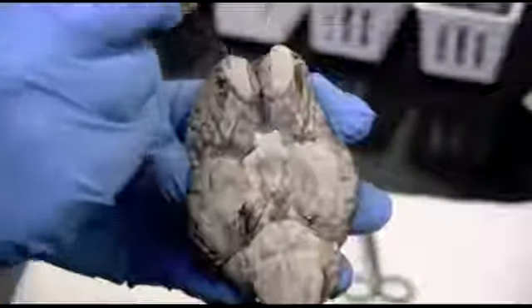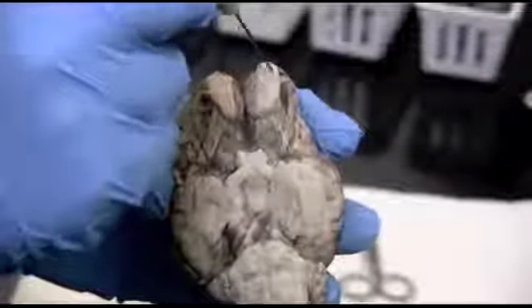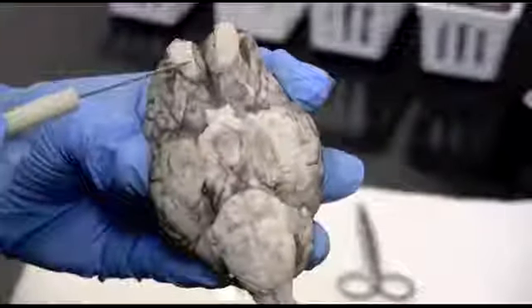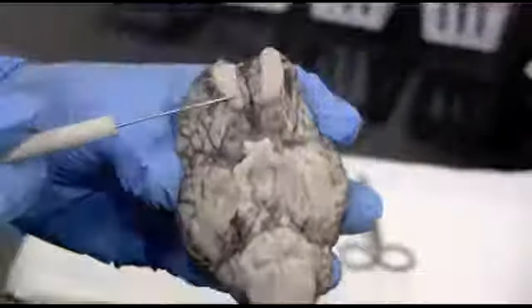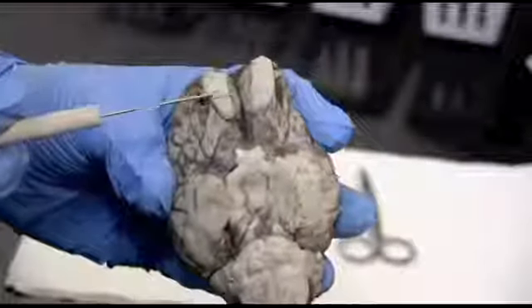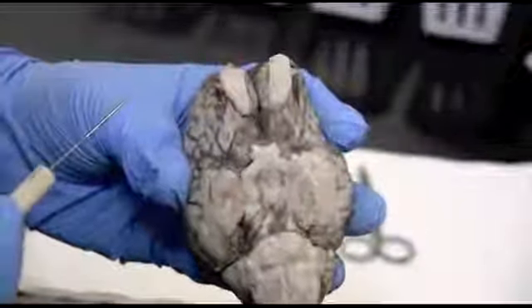That's going to have a connection with the olfactory nerves coming up through the skull bone, synapsing right there into the olfactory bulbs. And then there will be a tract running down that continues the information inside the cerebral hemispheres. But these bulbs are going to be what we'll consider, for labeling purposes, the olfactory nerve, or cranial nerve 1.